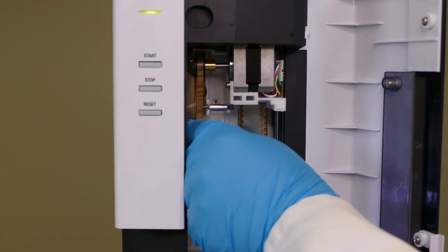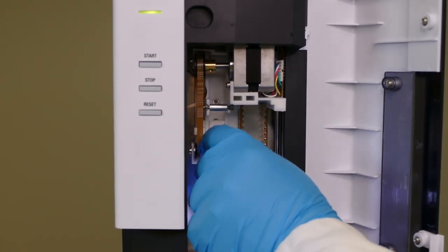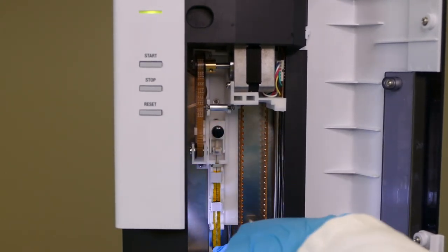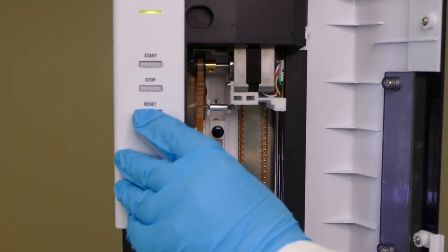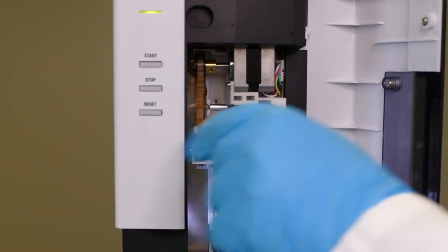The plunger holder is placed on the syringe and locked in place by pulling the drive belt up. Make sure that the syringe plunger is completely down, then press the reset button for the zero adjustment.